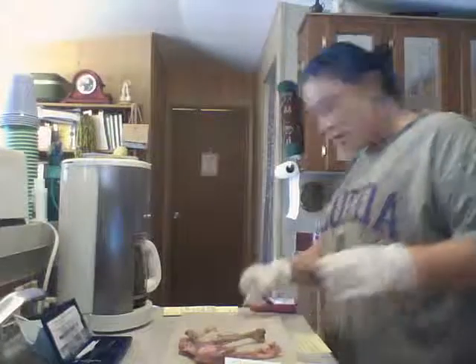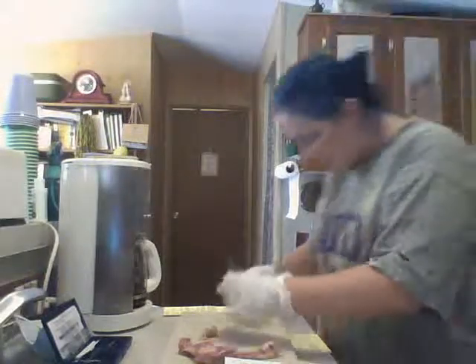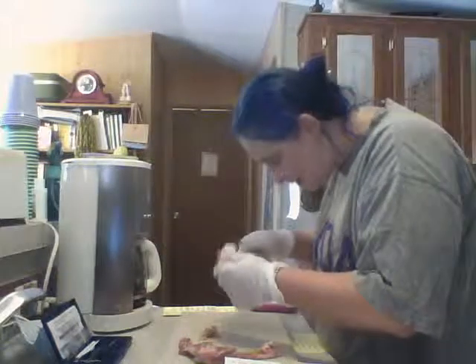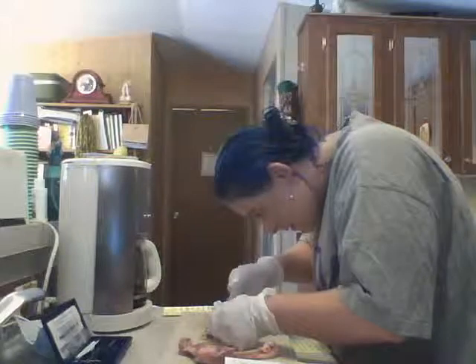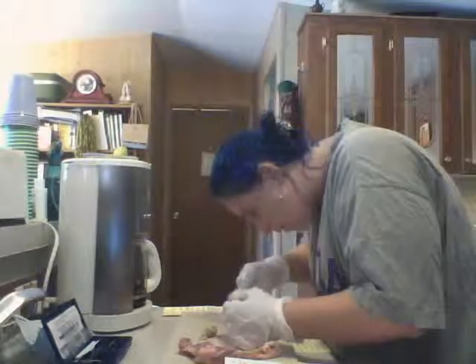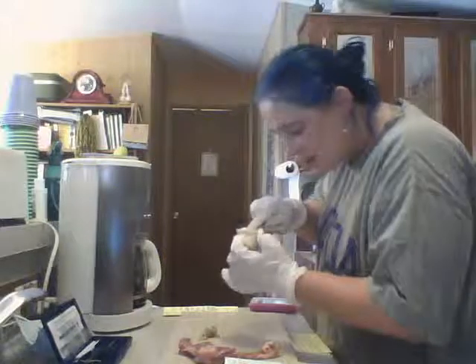Okay, so looking for the periosteum, but it's not cooked bone, not really.